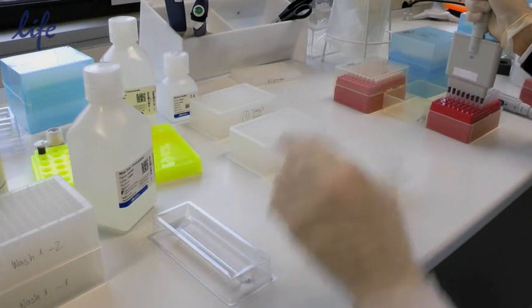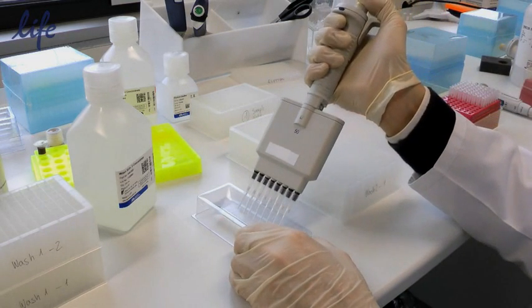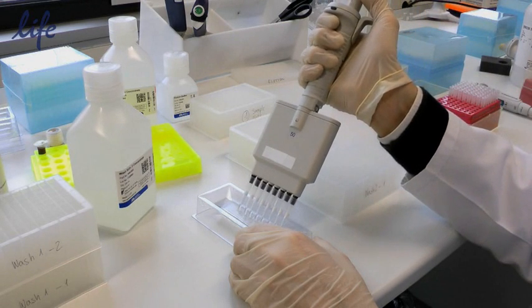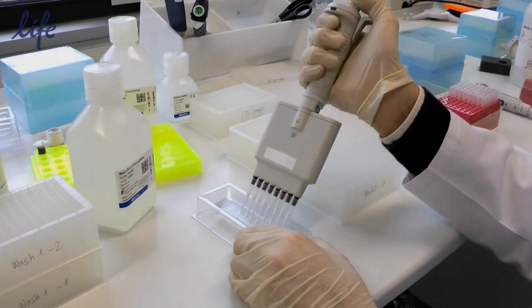Now we're going to be pipetting wash two. Again it's going to be two plates and once again we can do this quickly with the multi-channel pipette. We'll fill them all up systematically without needing to change the pipette tips.